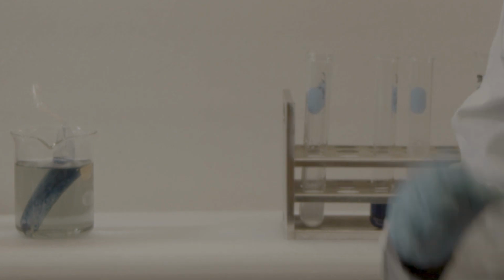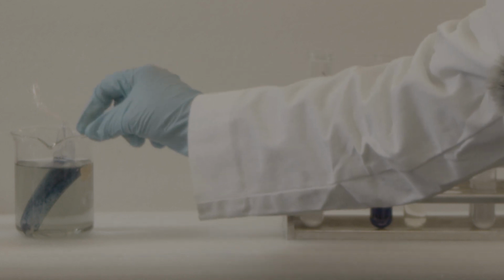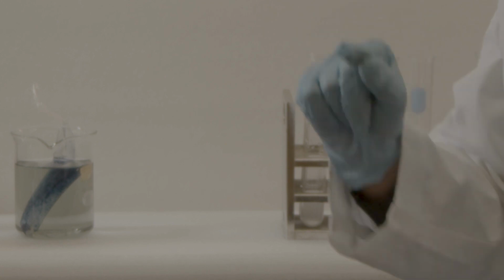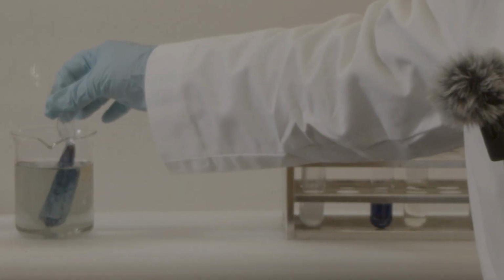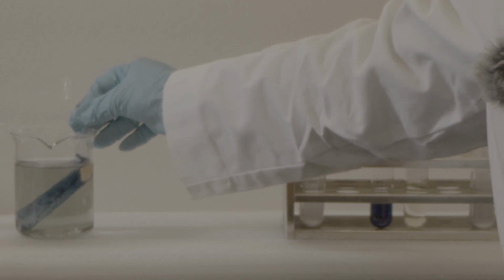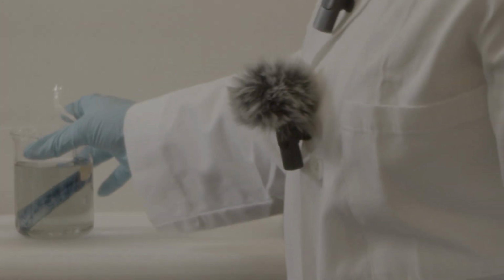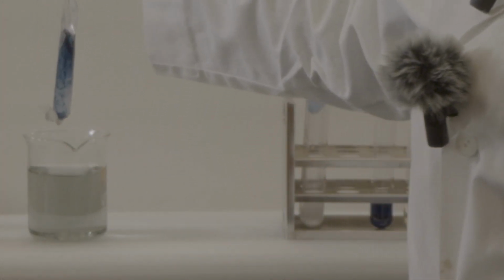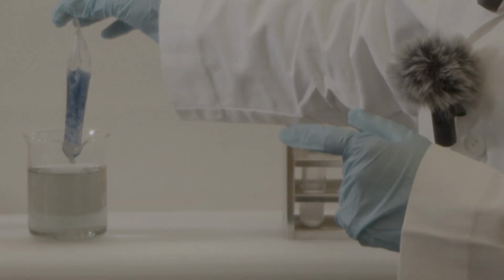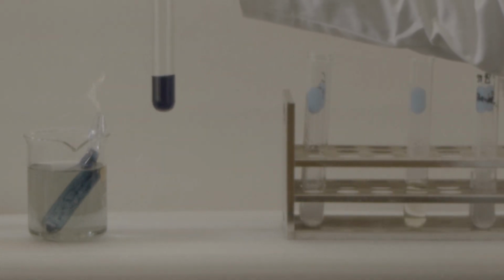So we came back after another 30 minutes to see what happened when I put my iodine solution inside the jar, and whether my iodine ion passed through the semi-permeable dialysis bag or not. Okay, so see what happened. The iodine goes inside. How do I know? From my standard result.